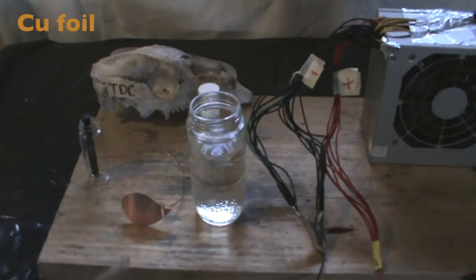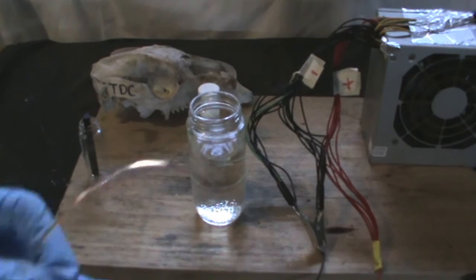Then cut a copper foil that fits into a plastic pipe, exposing the bottom part.